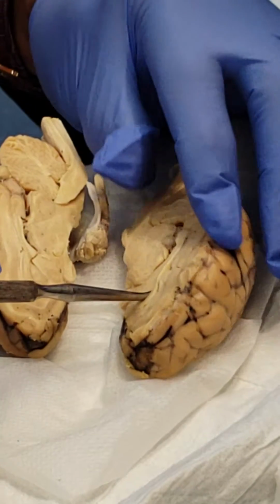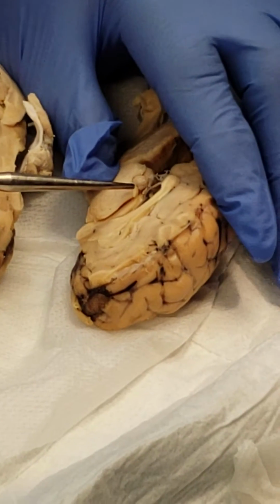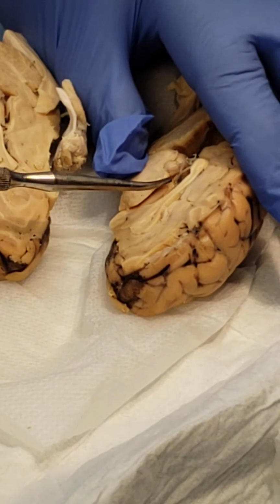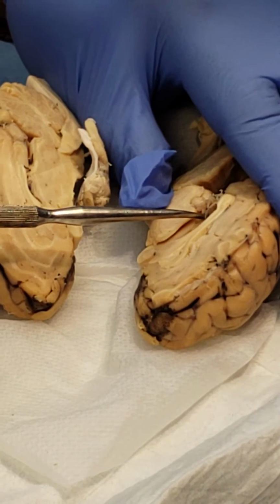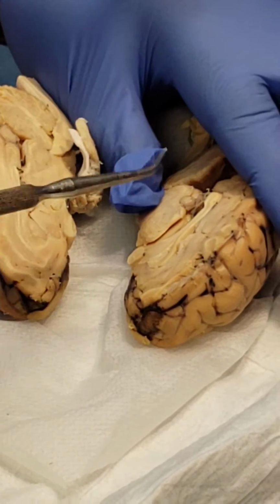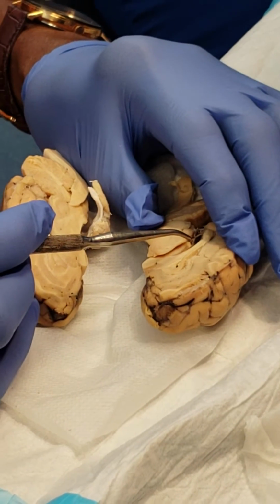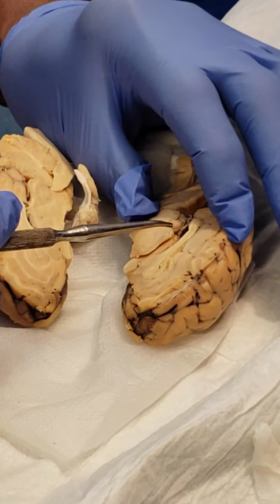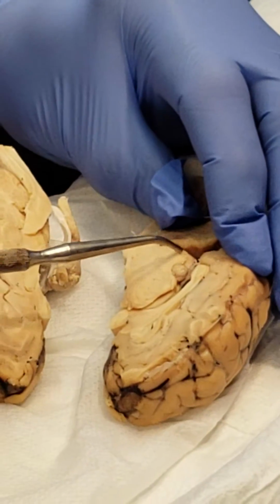This is where cerebral spinal fluid is filtered. You see this? This is not blood. This is the third ventricle. Fluid flows from the lateral ventricles to the third ventricle. These are the cells that filter the plasma. It's called choroid, C-H-O-R-O-I-D. The choroid, if you look at your book, consists of glial cells. The glial cells are called ependymal cells. The ependymal cells filter the plasma and they have cilia, so they aid in causing the cerebral spinal fluid to flow. Now, from here, it goes into the cerebral aqueduct.